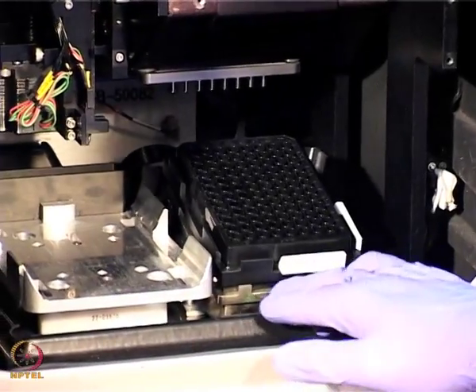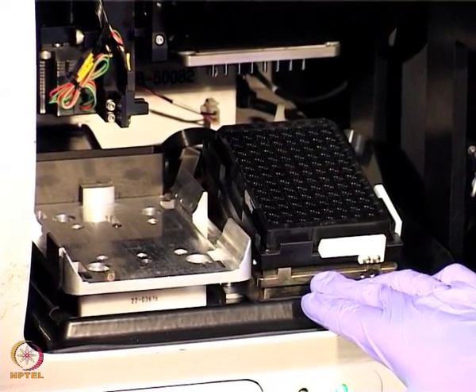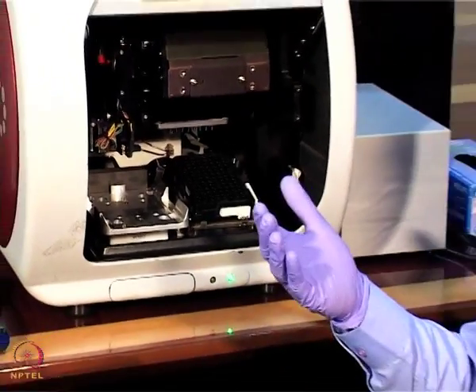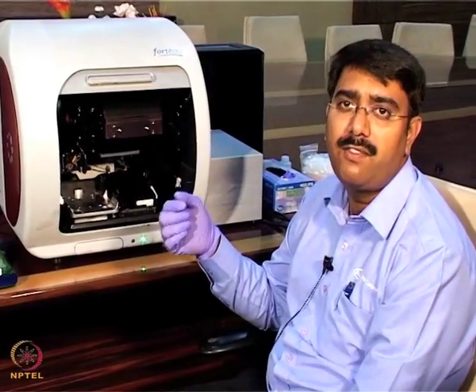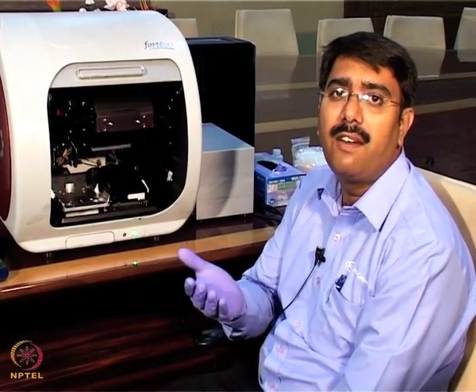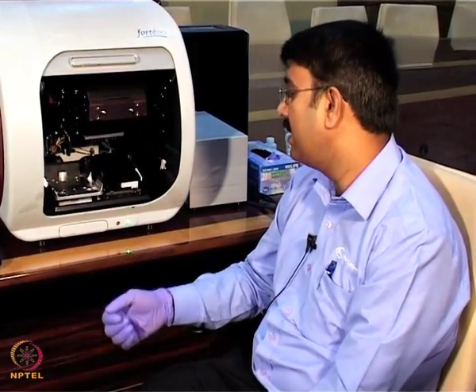This sample compartment, if you look at it, works on the dip and read method; the BLI technology works on the dip and read method. Here we do not have any microfluidics devices. So to assist binding, we have a shaker. That shaker assists in the binding. The shaker works from 150 rpm to 1500 rpm, and the sample plate also has temperature control. We can work from the ambient room temperature, like 23 plus or minus 4 degrees, to 40 degrees centigrade.